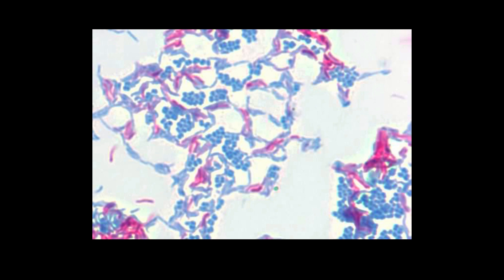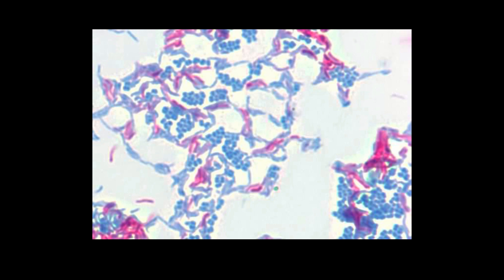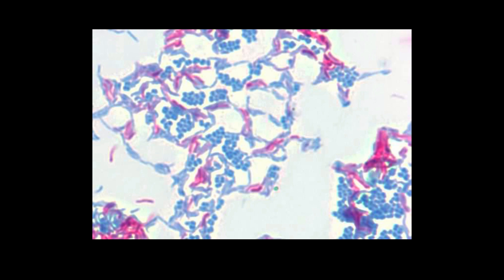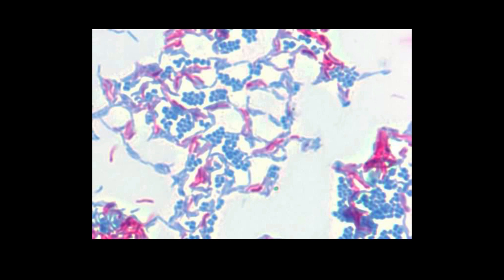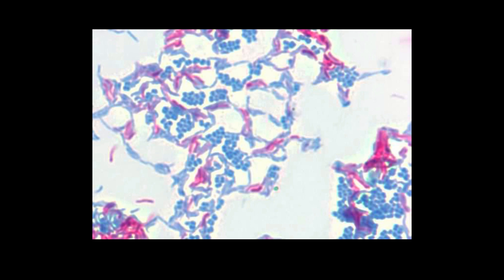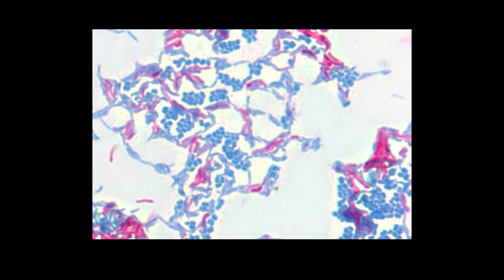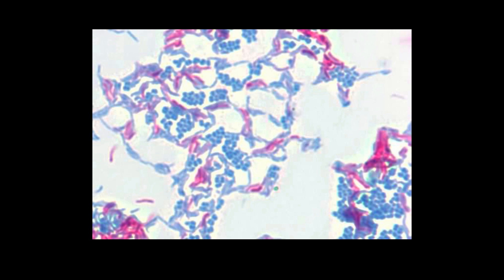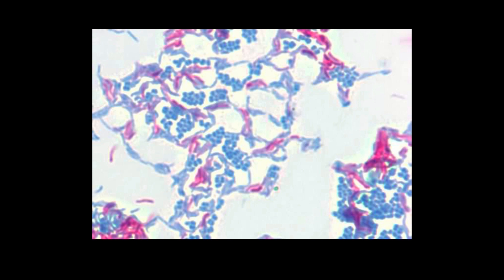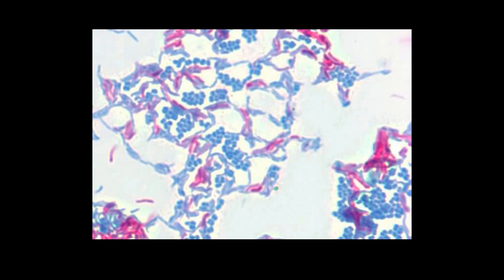This is an image of an acid-fast stain — not my image, this is from the University of Wisconsin. My mycobacterium culture was too spread out and I couldn't get a clear field of view showing both the acid-fast mycobacterium and the direct-stained Staphylococcus. But you can see the same result: blue-stained Staphylococcus, because the methylene blue is our counterstain, and pink-stained mycobacterium, because those mycolic acids in the cell wall hold on very tightly to the carbolfuchsin. This is what an acid-fast stain looks like under the microscope.